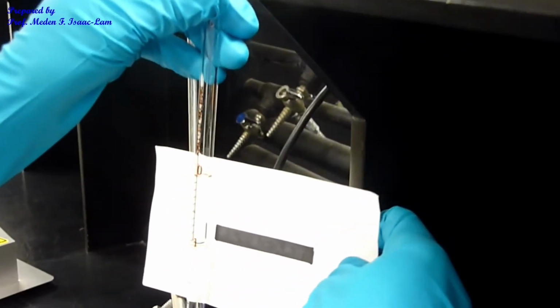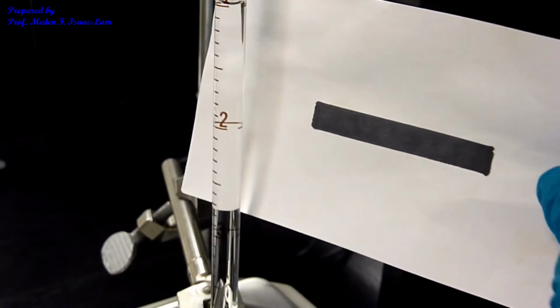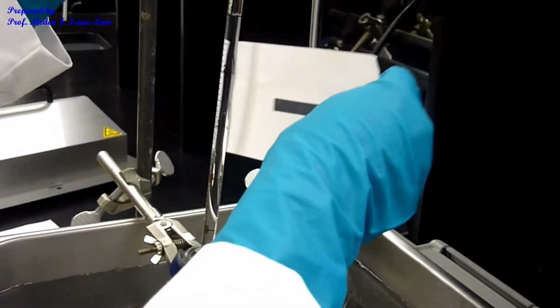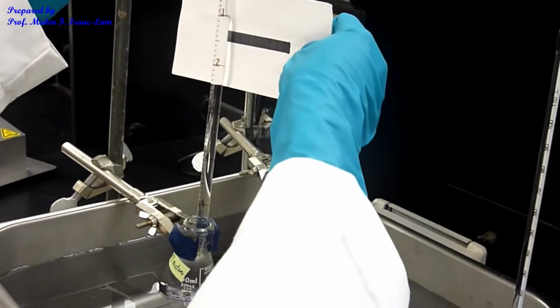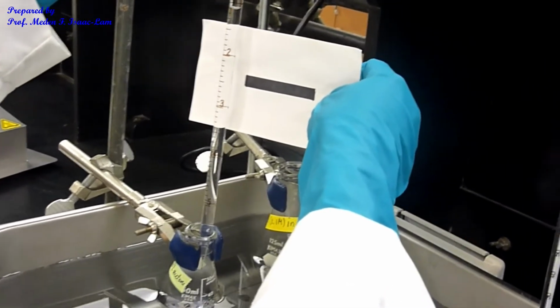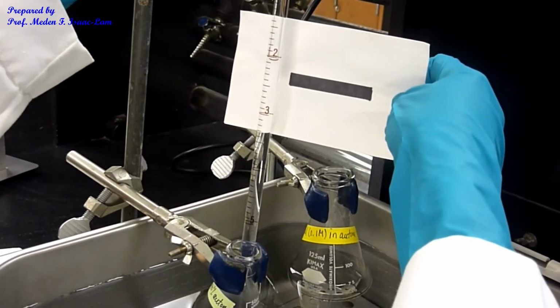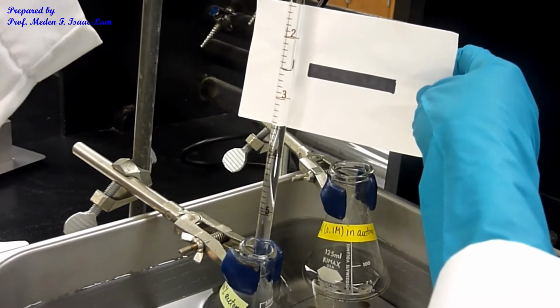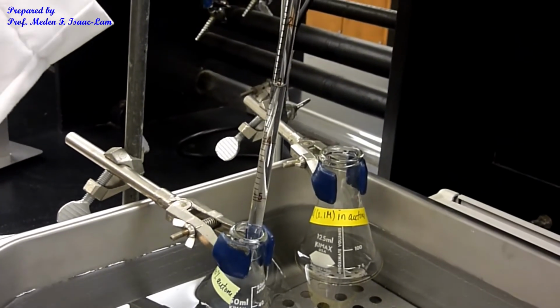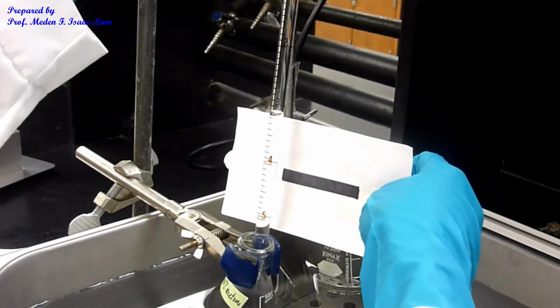So I want it at 1 ml mark. And then I'm going to add here up to 2, up to 3. So I'm delivering 2 ml. So remember, I need 4, right? So now, half of the volume, and then I press start, and then I'm going to deliver up to 5.